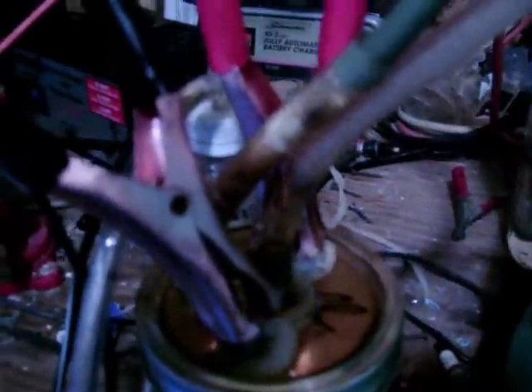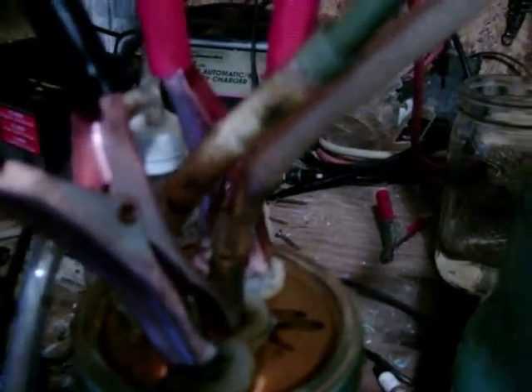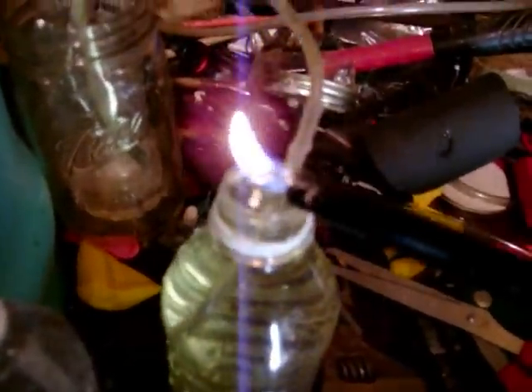As you can see, if you can see through all this here, one is the main supply for the bubbler to clear. And the other is coming right out of here, and the other is coming right out of the top right there, and coming right over to here, and right down to this one here, which is the oxygen which is being extracted. No flame, none whatsoever. And here. Big difference. Big difference. Very little, if any.